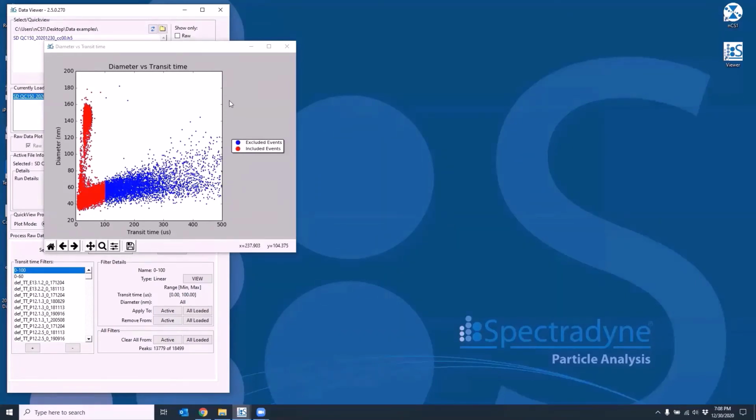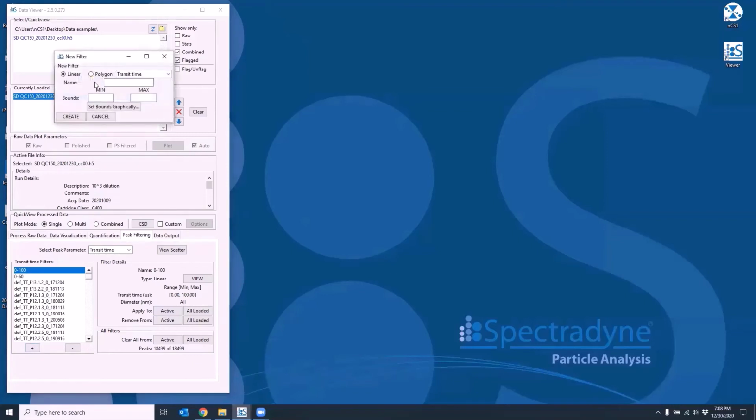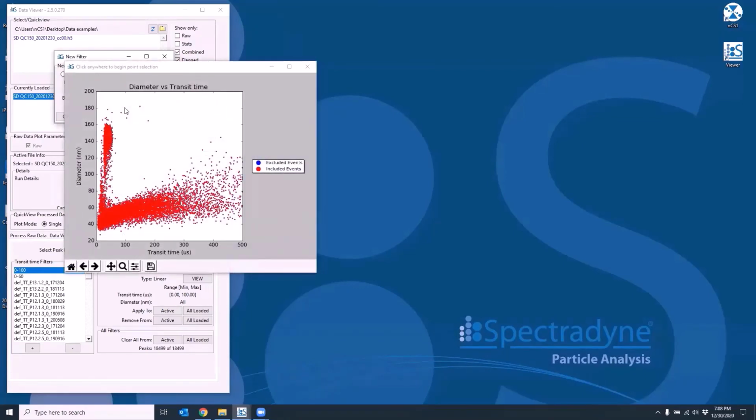Now let's create a polygon filter. First, we need to remove the previously applied filter. We're going to go over to the Add Filter option and select Polygon filter in the transit time. Specify a descriptive name for this filter. For the polygon filter, we have to click on set boundary graphically. The transit time scatter plot will be shown, and from here you can create your own custom polygon shape.